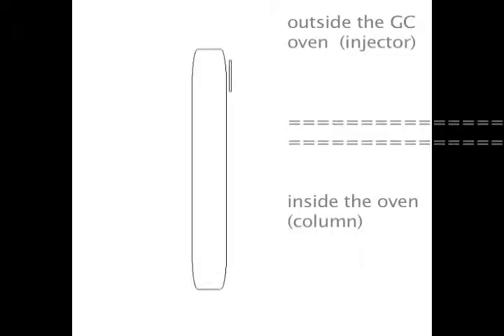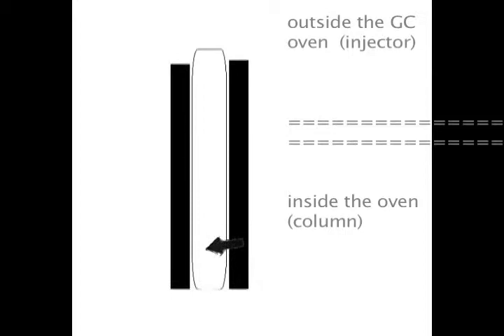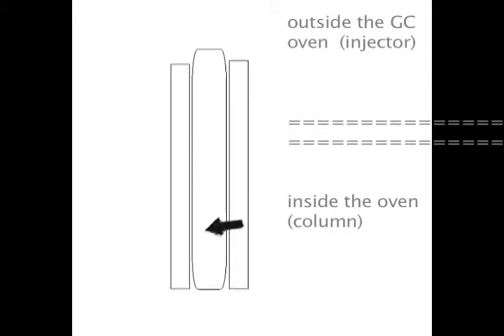And let's take a look at this. The injection system takes a lot of different forms with different gas chromatographs, but I think this is a pretty good general representation. The port liner is nothing more than a glass tube, about the diameter of a pencil, about two and a half inches long. It is held freely from the top and the bottom in a sleeve.